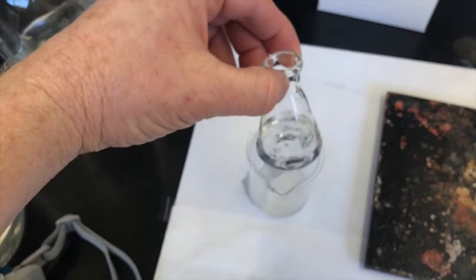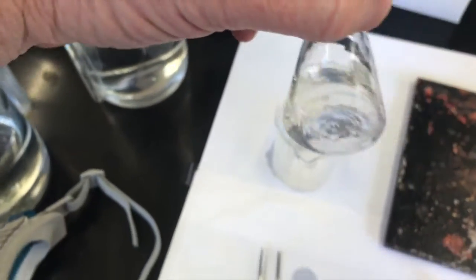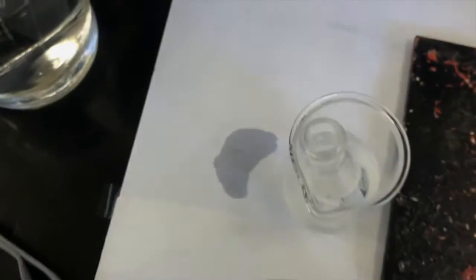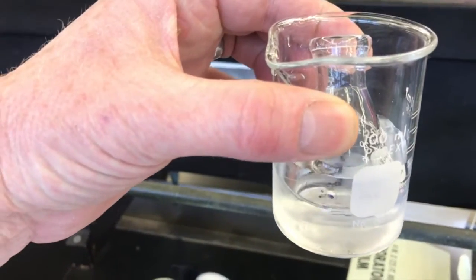And I took my leftover crystallization solvent, methanol, the little boiling stones, and I put it in a beaker of ice water to cool it down, to help me transfer. And I chose a beaker that was just big enough so that the Erlenmeyer flask can't fall over. Good.